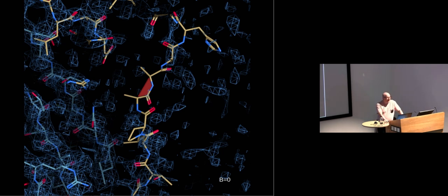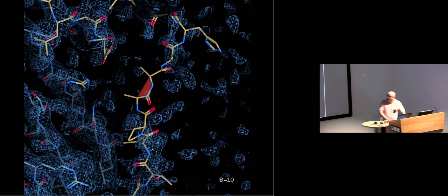5A1A, where the map was rather sharper than perhaps it needed to be. And you can see there's a particularly unfortunate piece of structure where we have a cis peptide in front of a residue that's not a proline. That's unusual, particularly in this case where there's little to no experimental evidence to support that particular configuration.